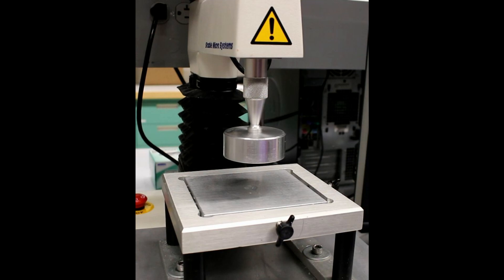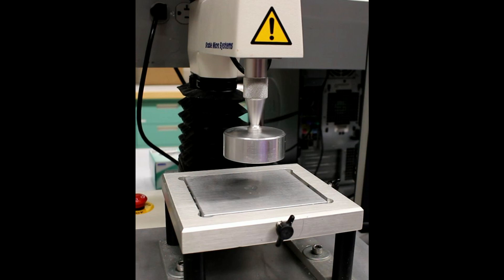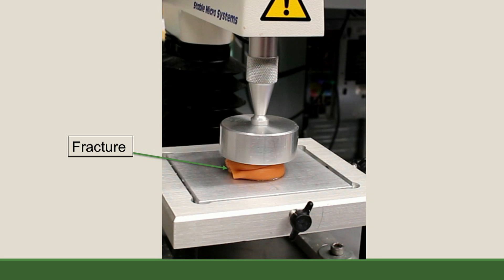Lastly there is the texture analyzer, which is a misnomer. Within food science, texture is measured by a human sensory panel, so you cannot measure texture with the texture analyzer. Simply, the texture analyzer has a platform and a movable arm that can be fitted with different attachments to run a wide range of tests. One of these tests is a single compression test used to determine what it takes to fracture a sample like a hot dog.